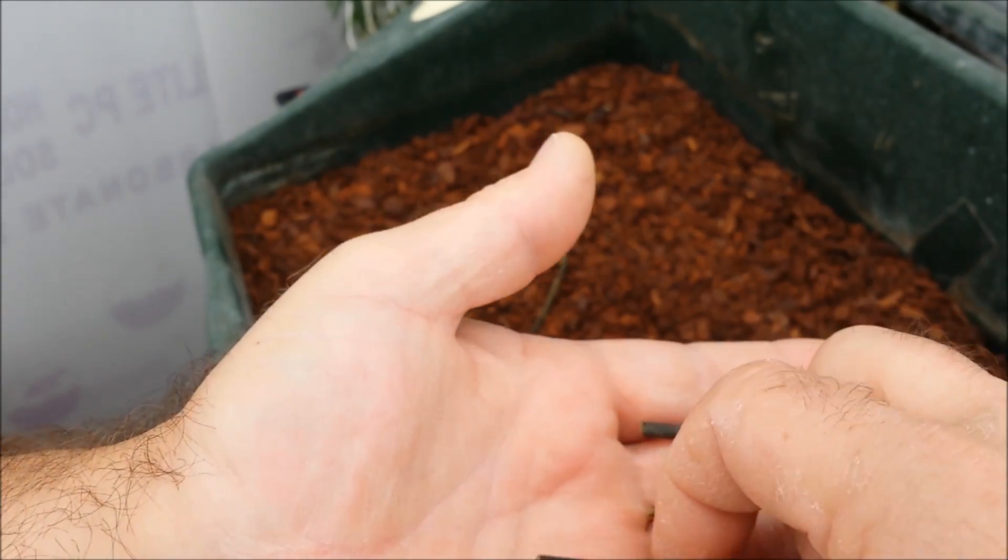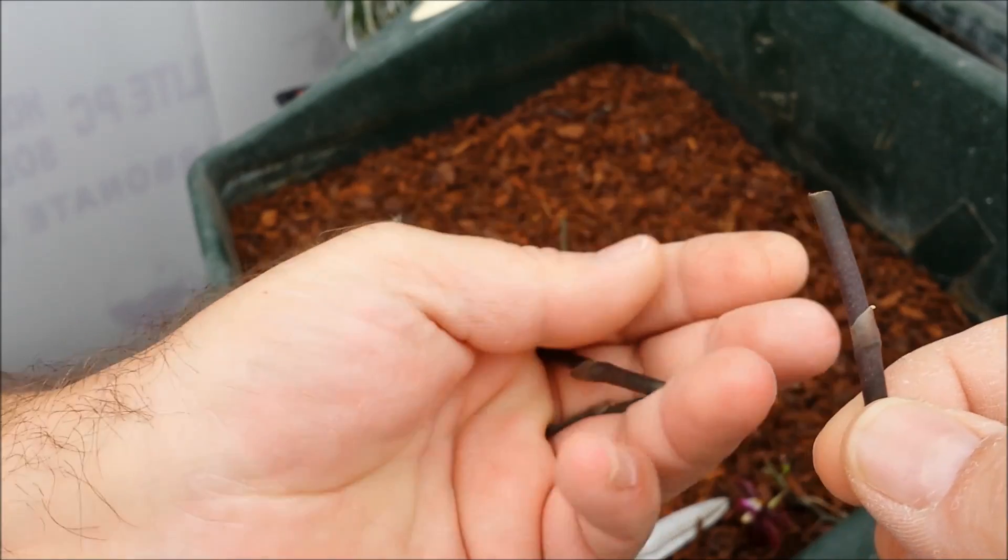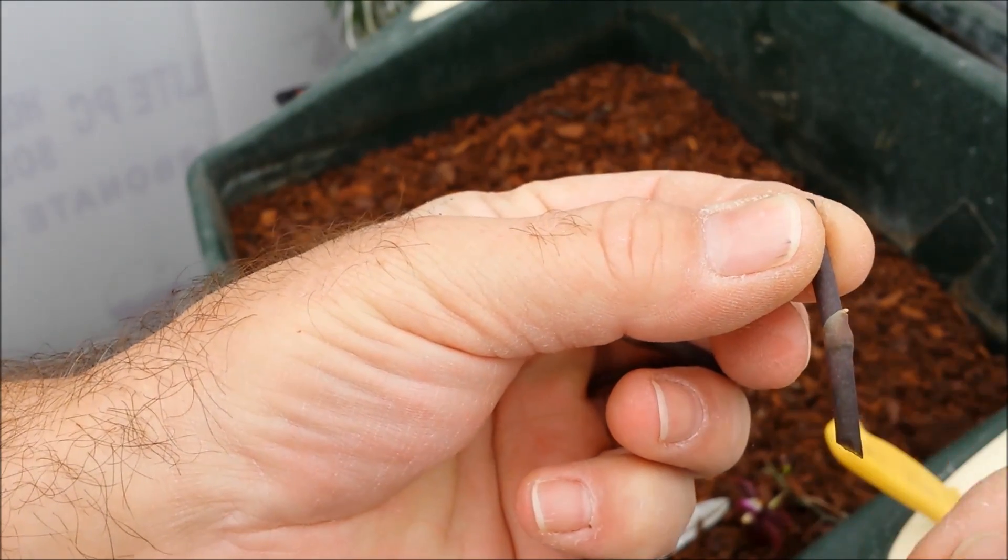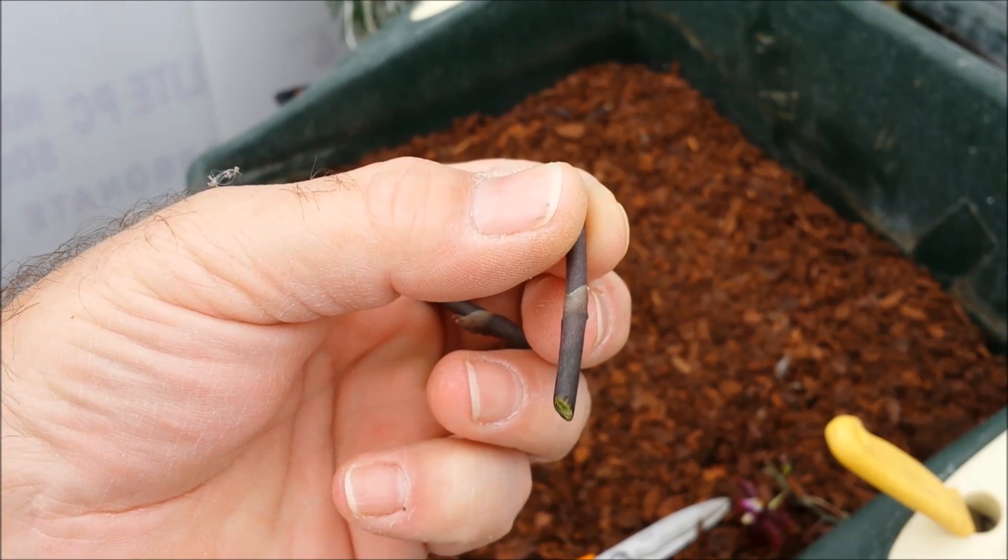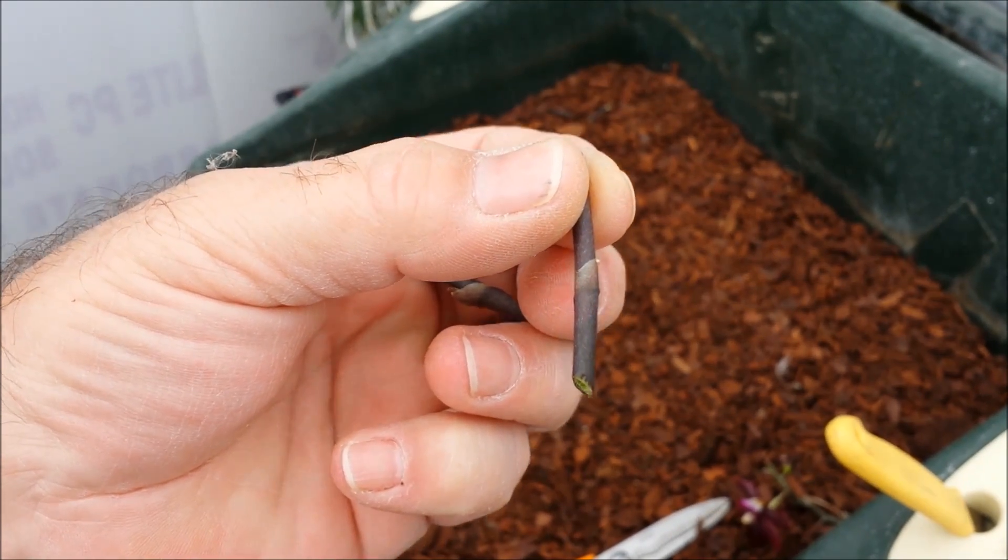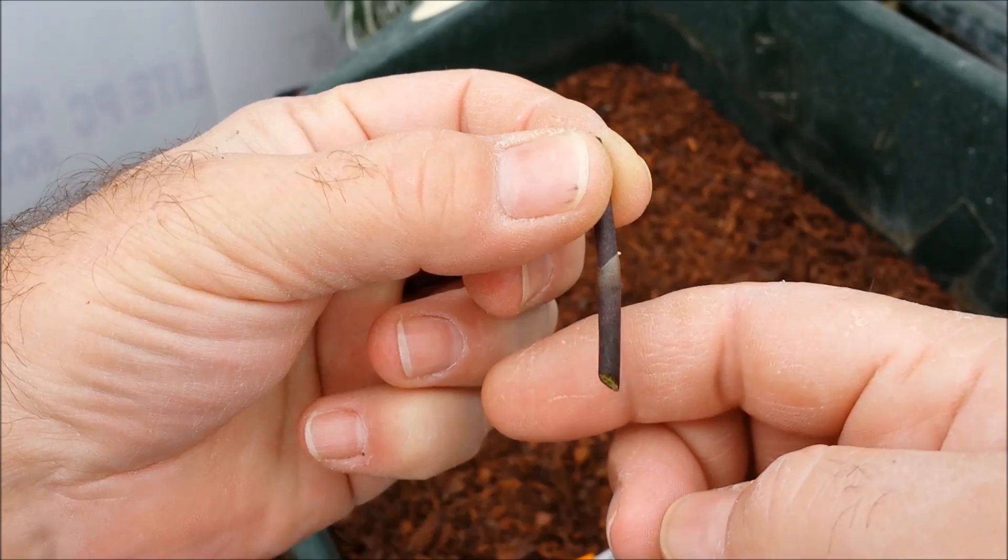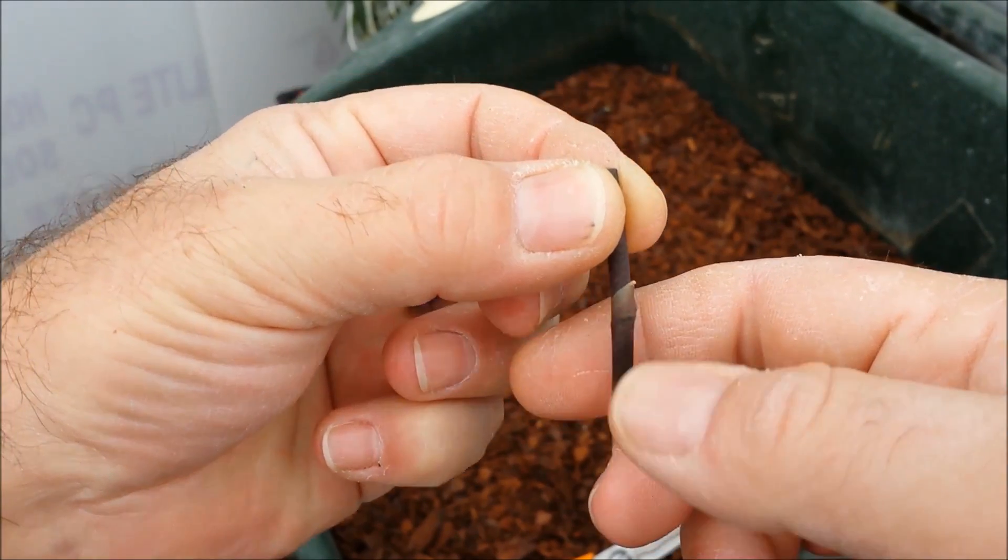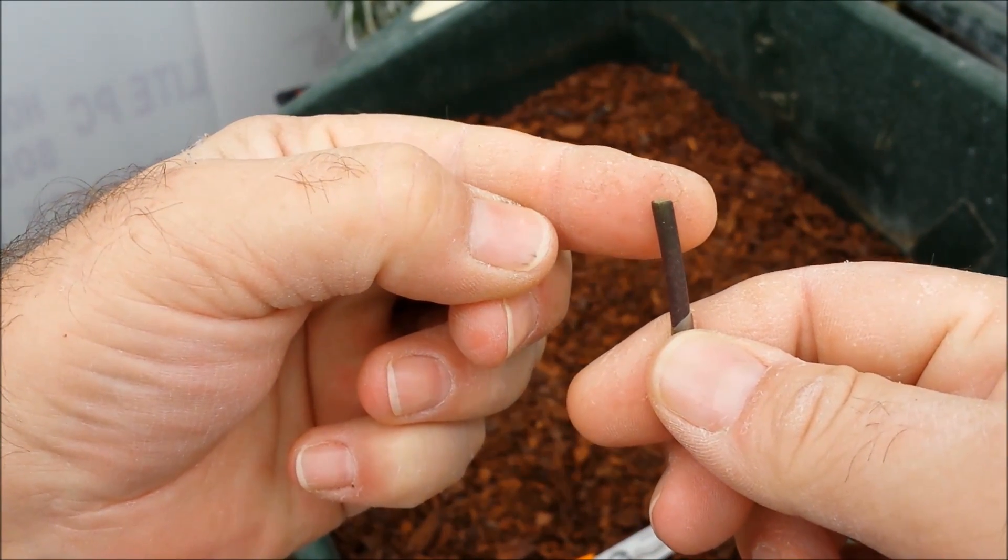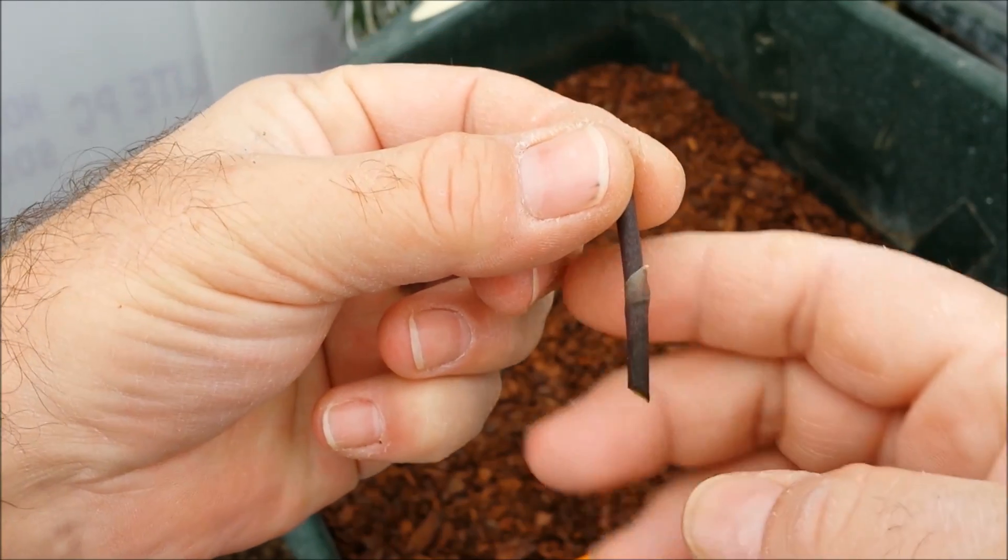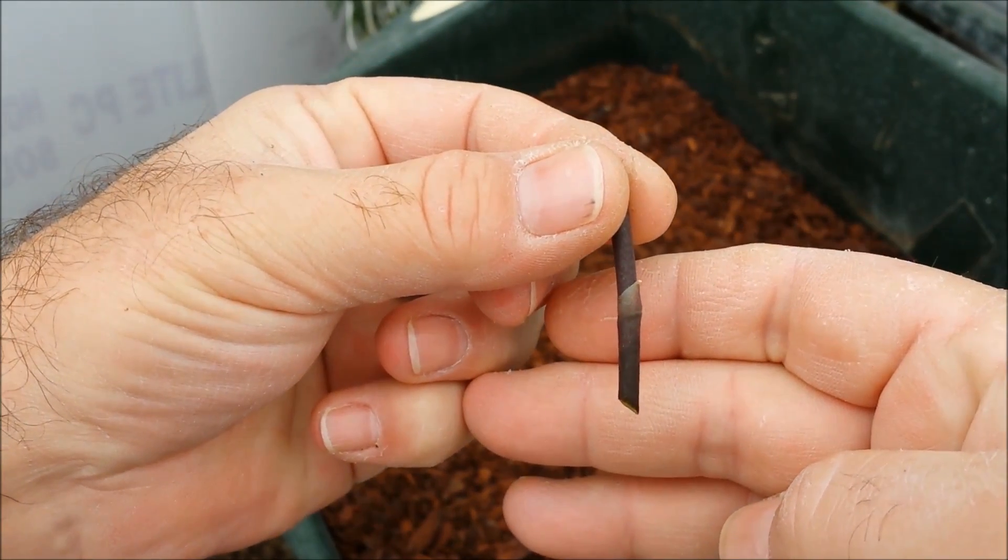Now the thing to notice about these is I've cut them and they're about an inch and a half to two inches long. The bottom end you see that I've made it pointed, and the top end is flat. That's really just so you can see which way up they are.